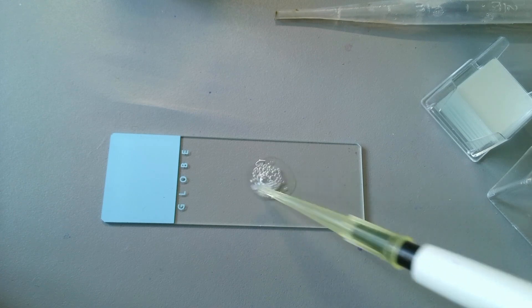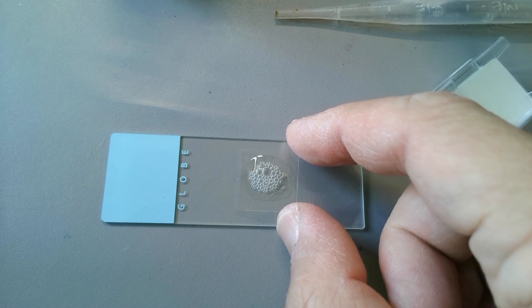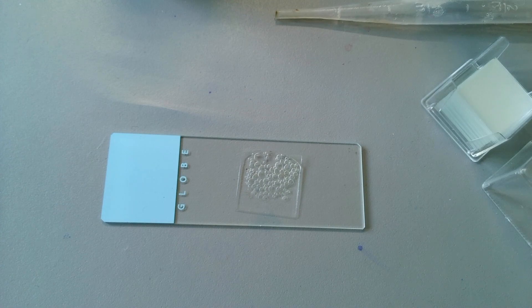The advantage of methyl cellulose is that the original cell shape is retained. So you can actually see that the cell is actually much elongated, almost like a cylinder. You can actually see also the cell rotating around. And essentially, you see the natural behavior of the cell much better. But everything is much slower because of the highly viscous solution. For this reason, it's not able to move quite as quickly.